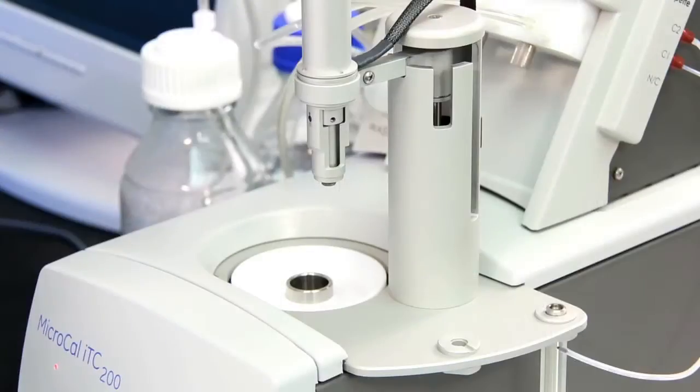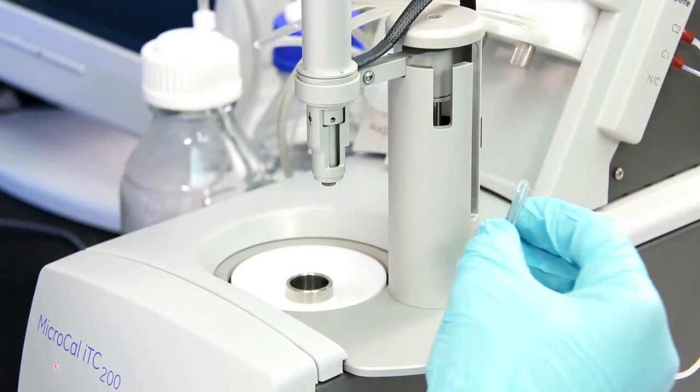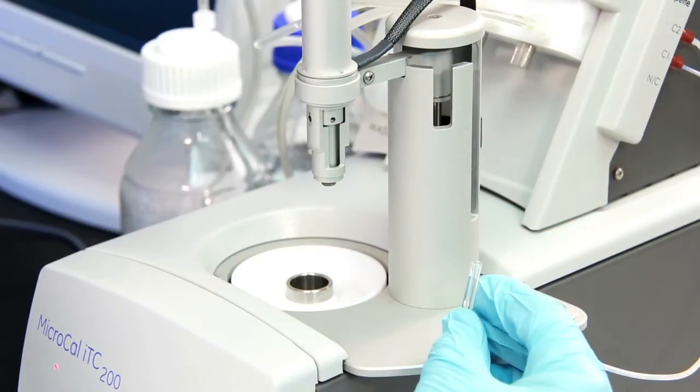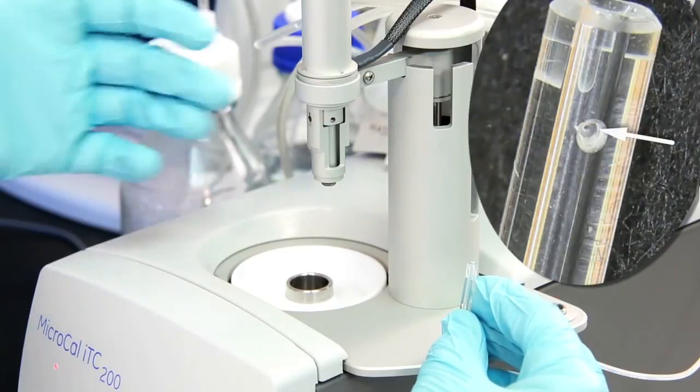To reinstall a syringe, we need to align the syringe to the pipette. First, place the syringe through the load station and rotate the syringe so that the fill port's facing outward.